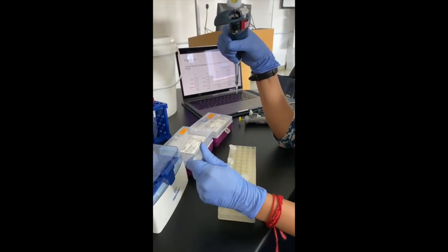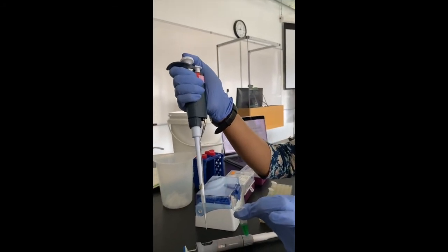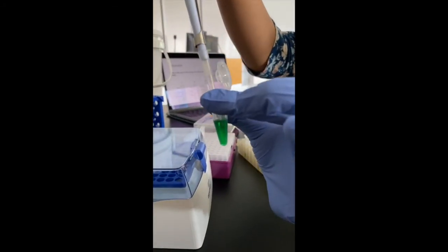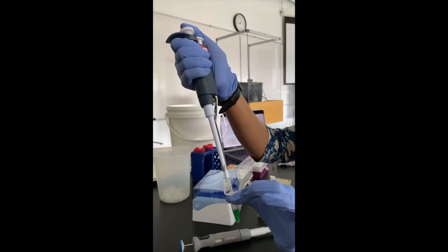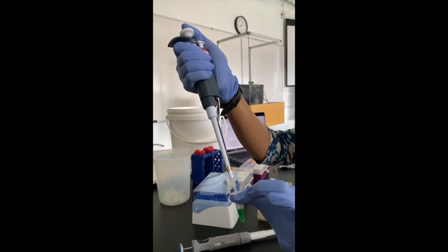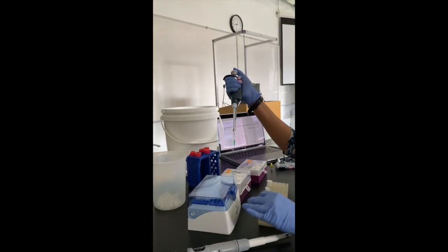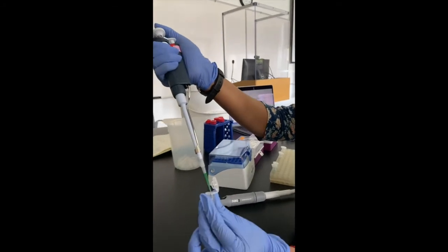So you open the tube, go to the state of first stop using the plunger, and then immerse the pipette into the liquid. Ensure it's not too deep and it's only 2 to 3 millimeters below the surface of the liquid. Once you've done so, gradually release the plunger, which will allow you to aspirate the liquid back into the pipette. Close this tube, go to your destination tube, open it.